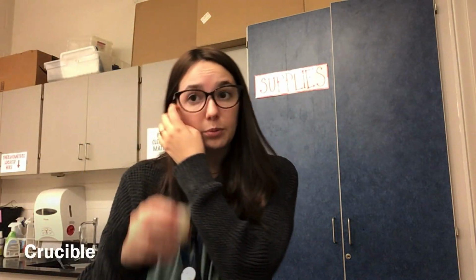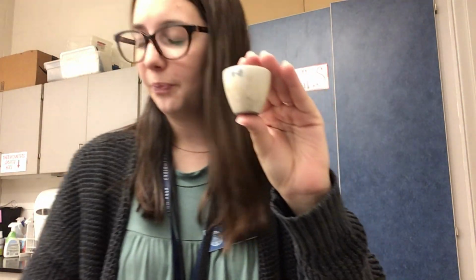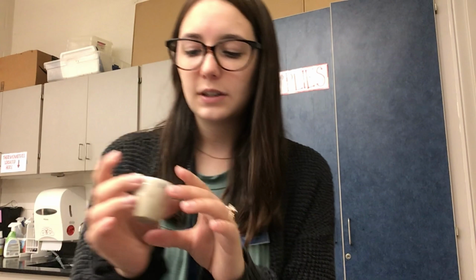Number 9 is a crucible, similar to our evaporating dish. Here's a comparison. Here's my evaporating dish, here's my crucible. Crucibles are used when you're heating up something, so typically I'm not evaporating anything out of this. I'd hold it over a Bunsen burner and heat up the sample that is inside.